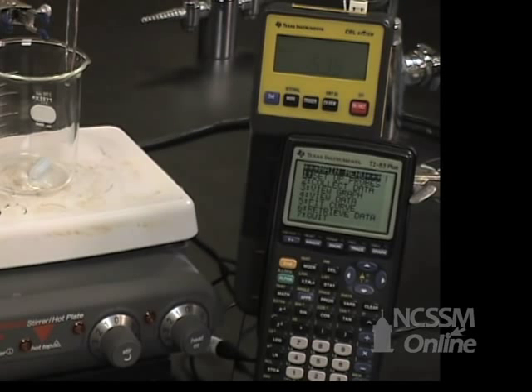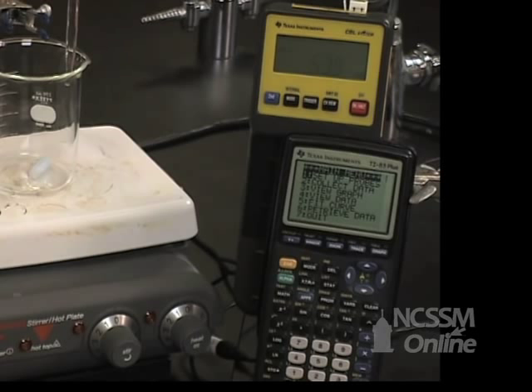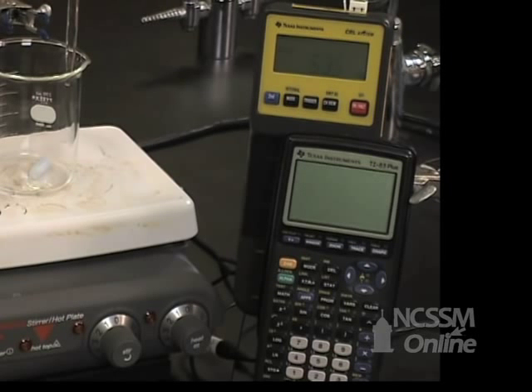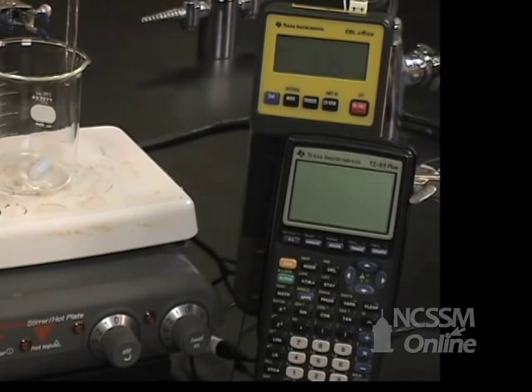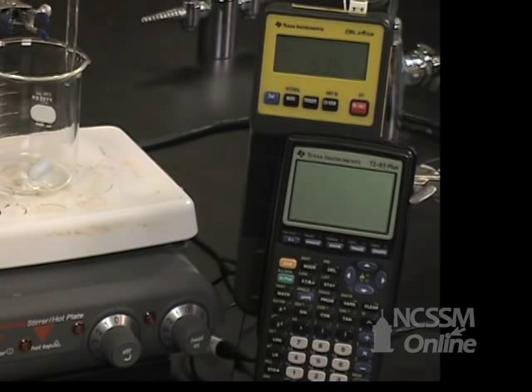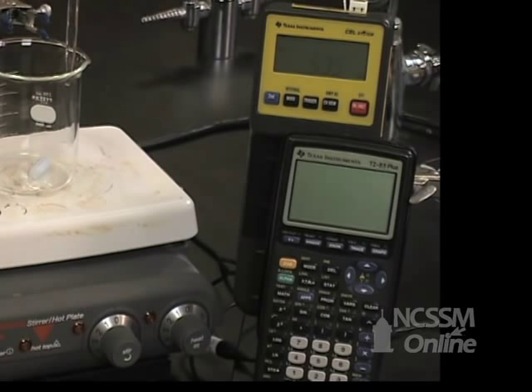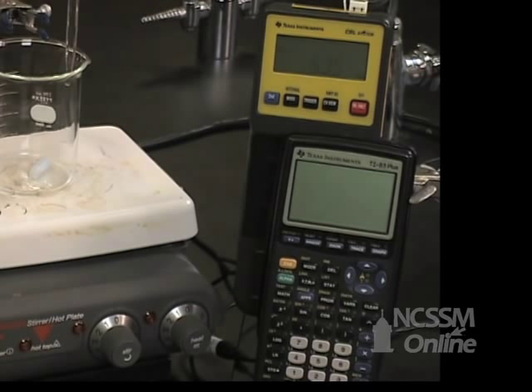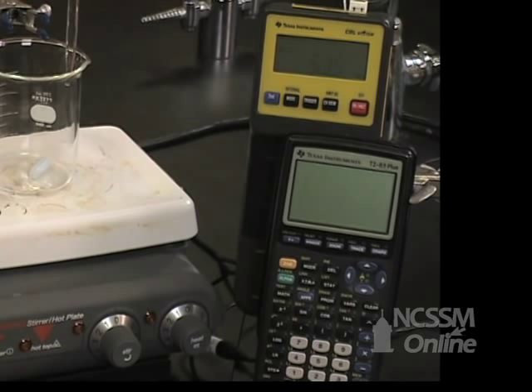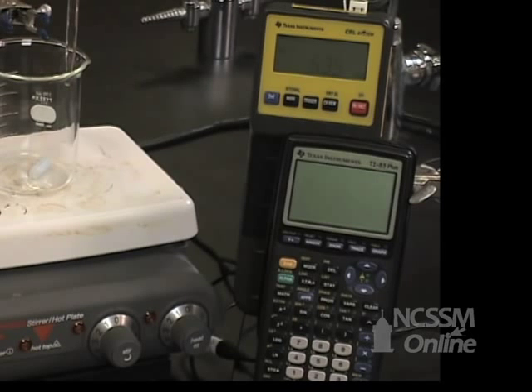You're going to know the volume and the molarity of the phosphoric acid and the molarity of the sodium hydroxide solution. This should allow you to calculate the first half equivalence point, the first equivalence point, the second half equivalence point, the second equivalence point, the third half equivalence point, and the third equivalence point. You should include those in your data collection.